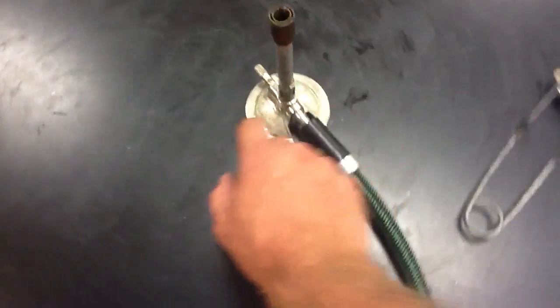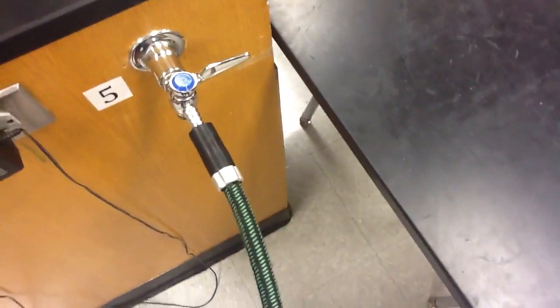Make sure the valve here is all the way turned to the right so no gas will escape when you turn on the other one. Alright, now that is done.